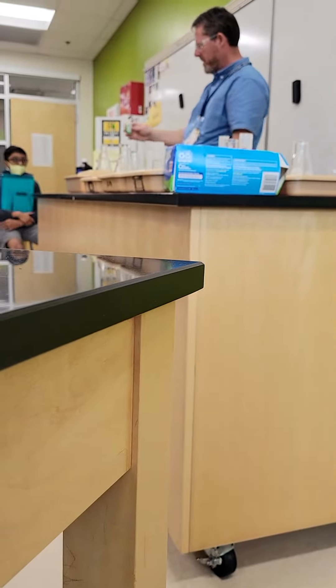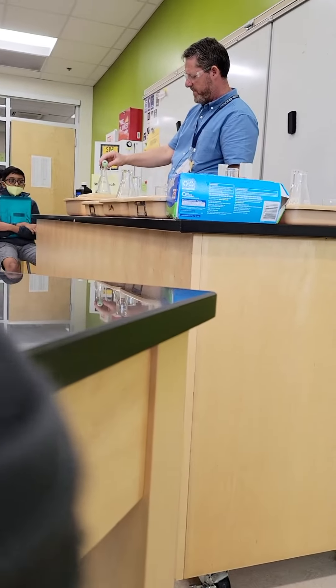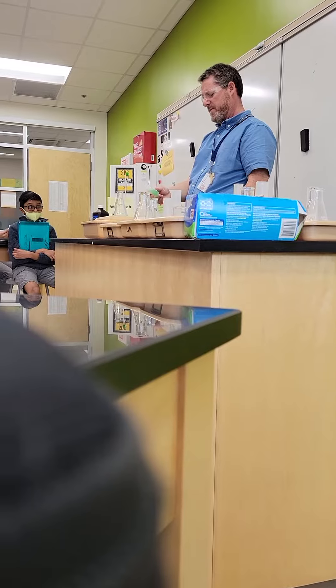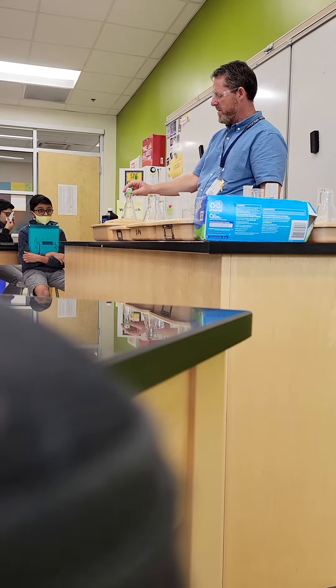I'm going to add a little bit of soap. This is about 10 ml—this is actually 30 ml, so about 30 ml.